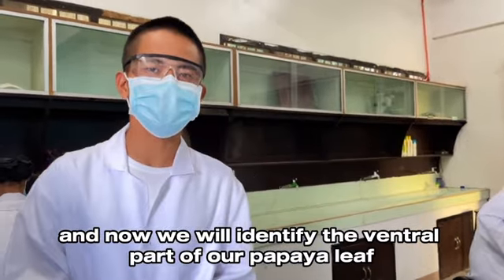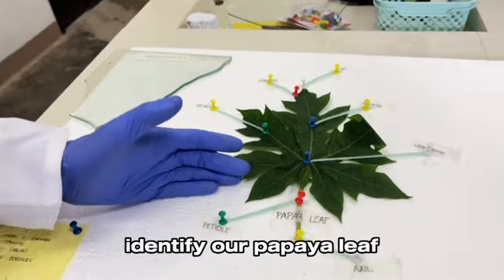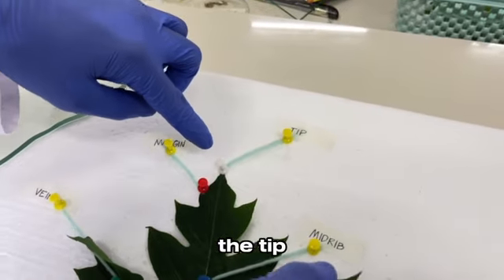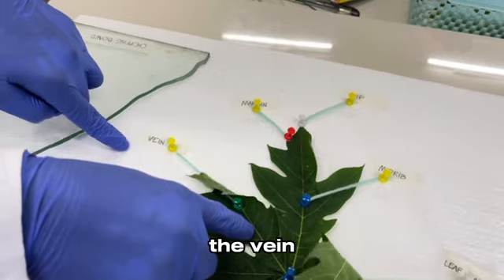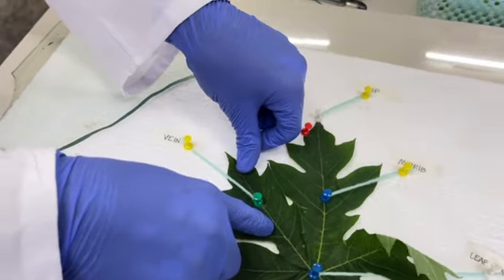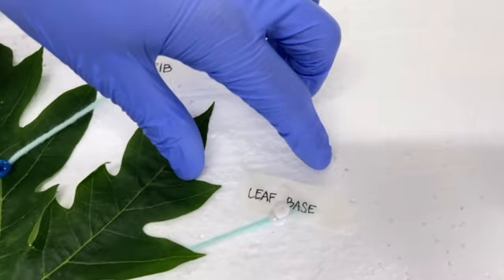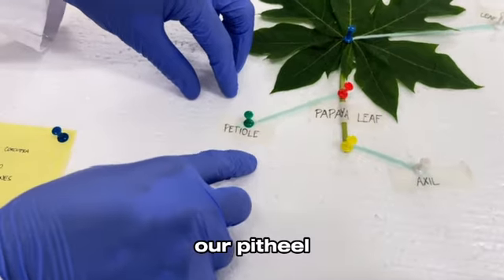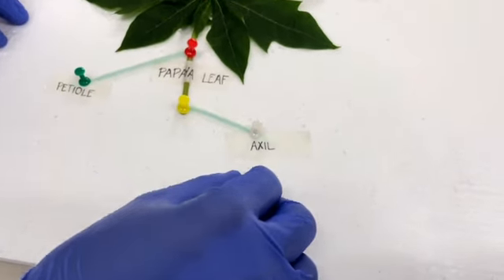And now, we will identify the ventral part of our papaya leaf. The tip, the margin, the vein, the midrib, our leaf base, our petiole, and also our axil.